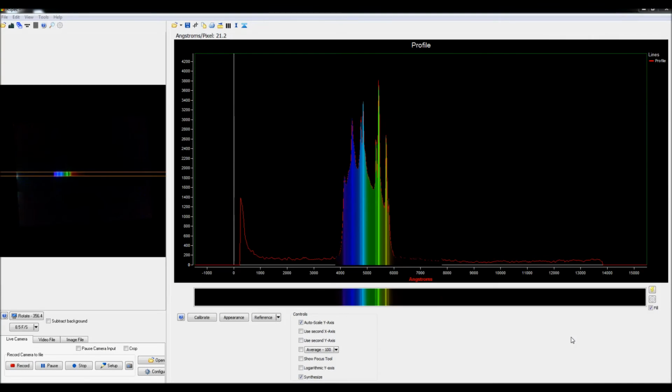All of the lines that you see here usually correspond with either a metal halide or a mercury bulb. But I'm going to go ahead and throw it into the program that I use called RSpec to get a better look at it. Now, if you've never heard of this program, it's a decent program. If you're looking to build your own spectrometer, this will certainly work for you, although it's more tailored to astronomy spectroscopy. Which isn't a bad thing, but it still works just fine for what I'm going to use it for.